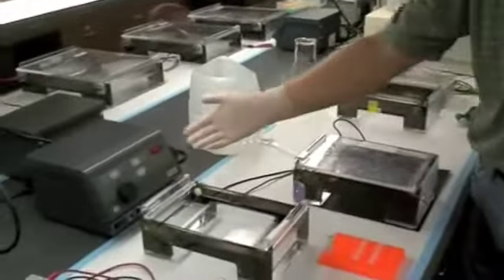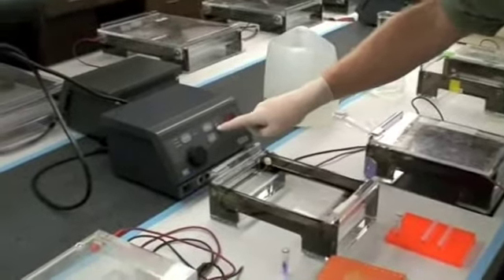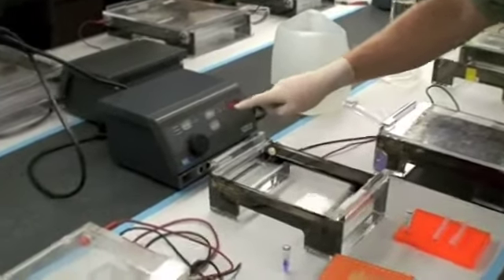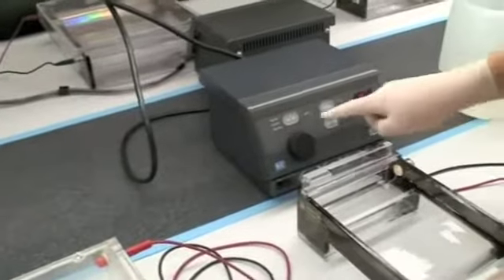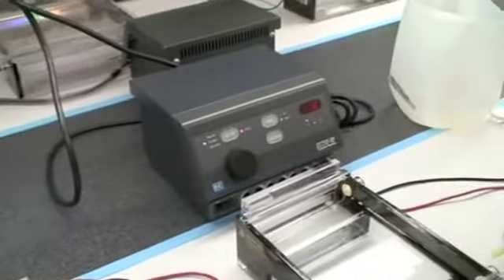Now it's not on yet. I've just set it, and it's not running. The machine is on. It's actual. So this is what it's set for, and then you can see the LED here. It's actual. It's zero. So when I hit on now, the direct current is on, and the actual voltage now is ninety.